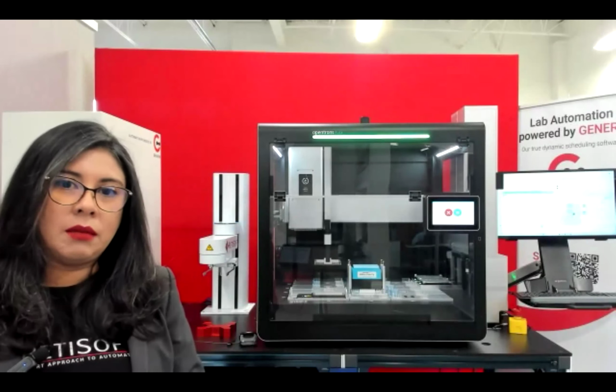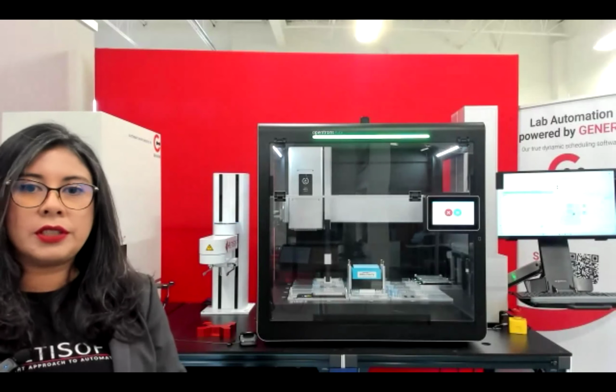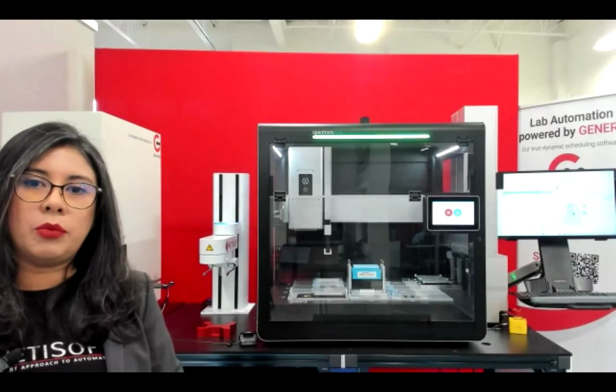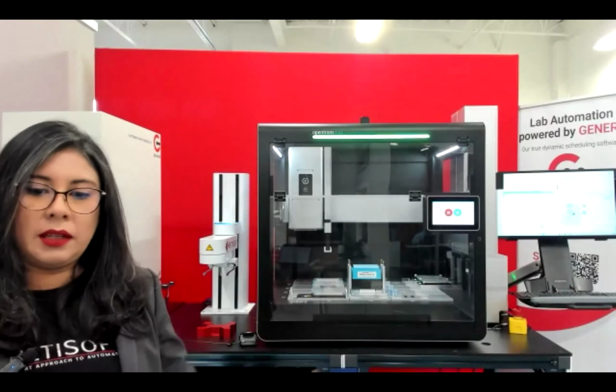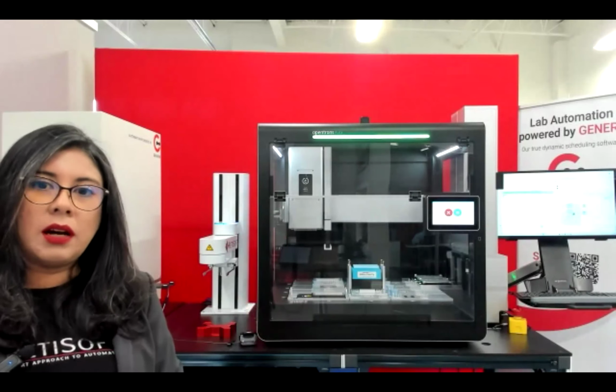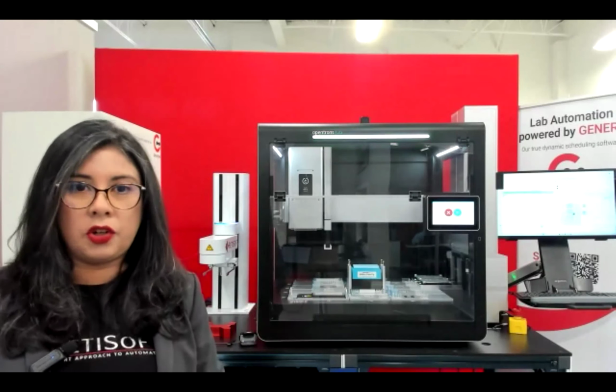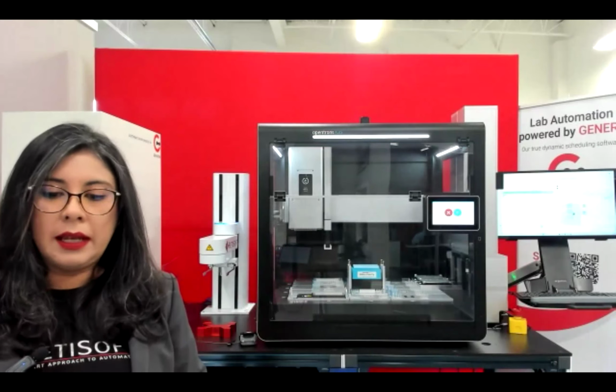You've done a great job already explaining the capabilities and all the benefits of the Opentrons Flex. And we put together with our team here at our headquarters a demo system to showcase the capabilities that we can bring up together with the Opentrons, with the robotic arm and the Genera software that we will explain further later on in the webinar.